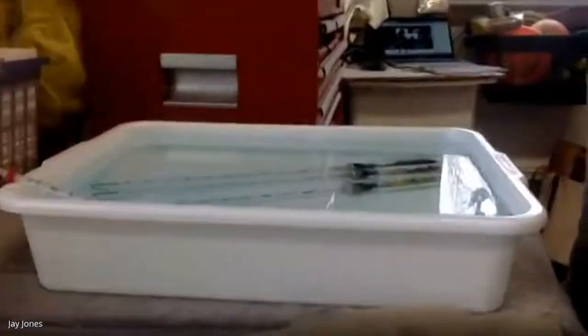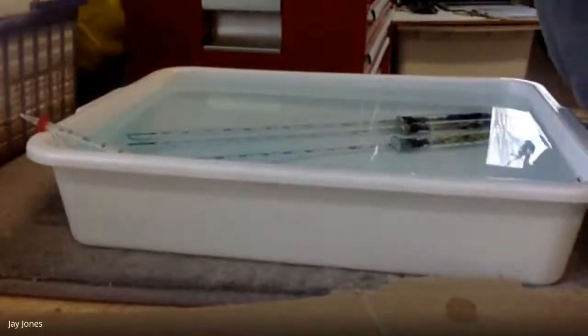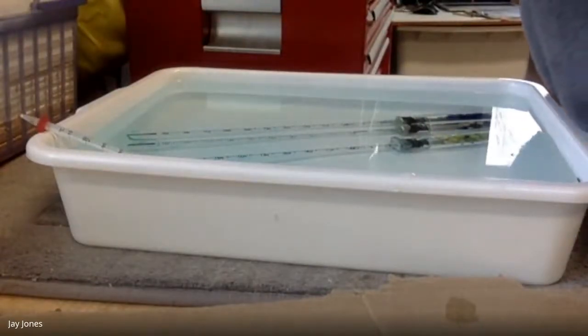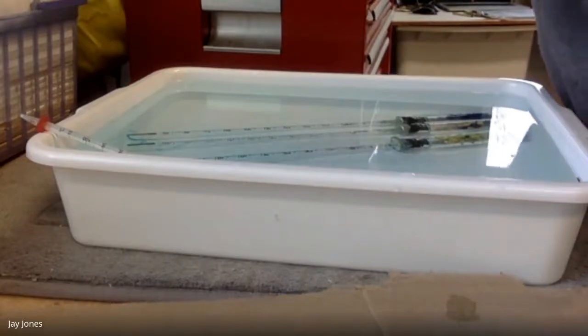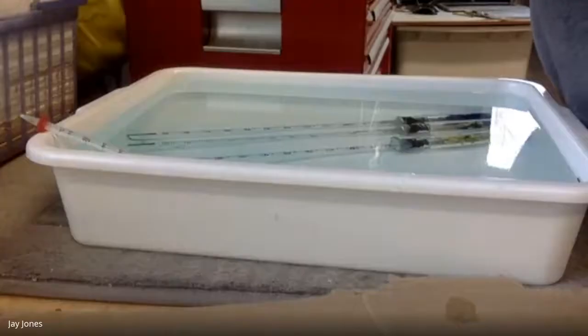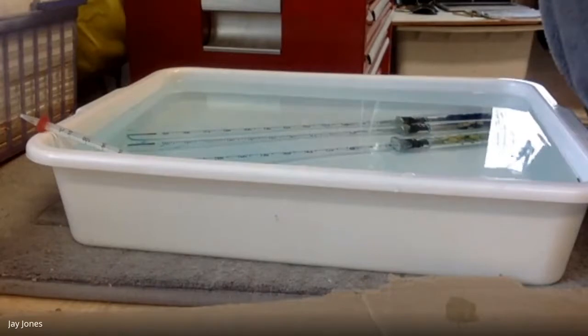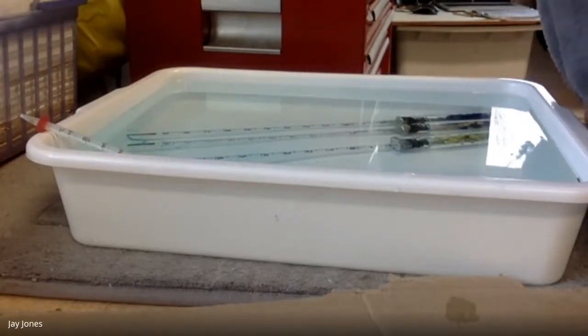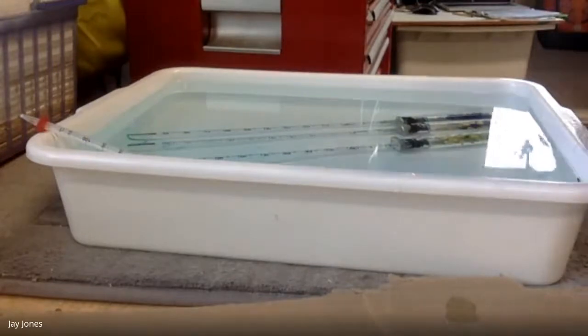Let me take a reading for Shreya. Okay, Shreya, here we go. Ready? For germinating peas, 0.83. This is the 3 minute, right? Yeah, 0.83. For dry, it's 0.92, and for beads, 0.92. Okay. Thank you. All right. So in 3 more minutes, we're gonna do it again. That's 11:49. All right, guys.